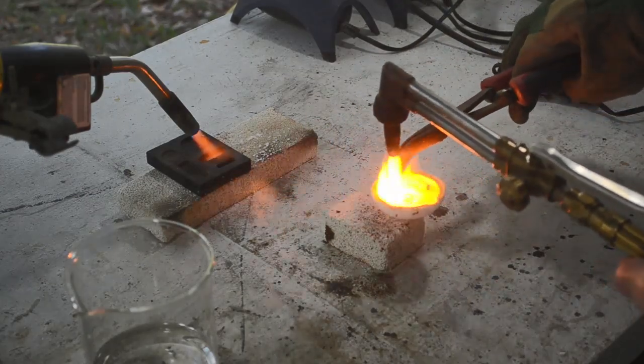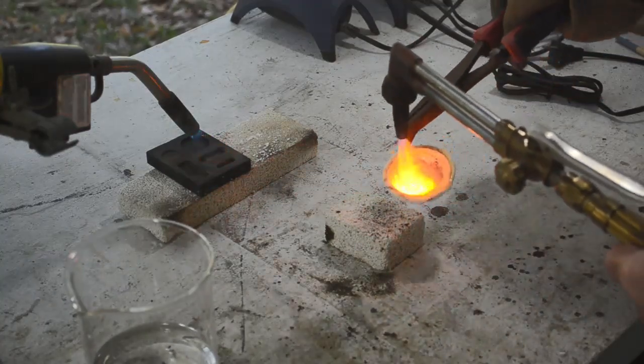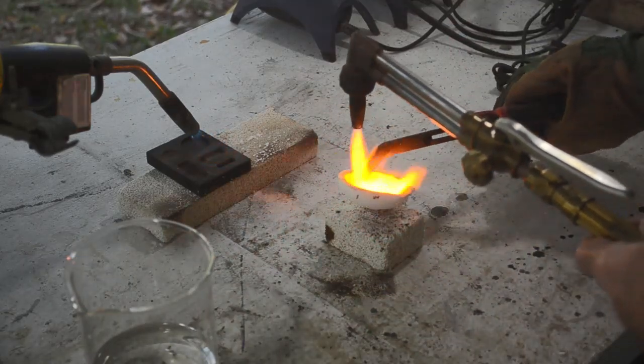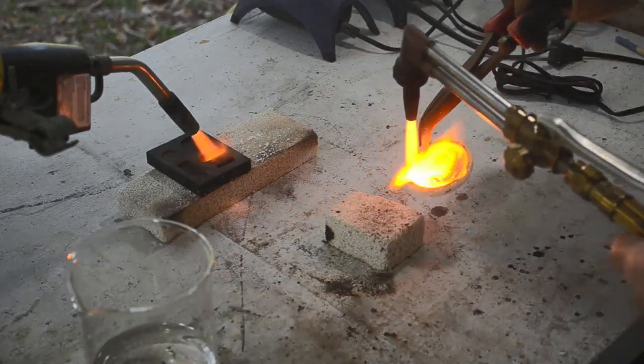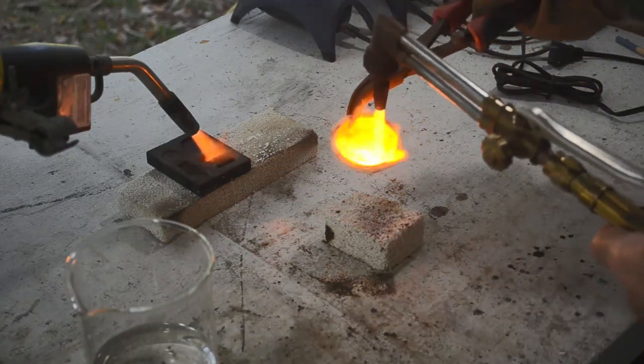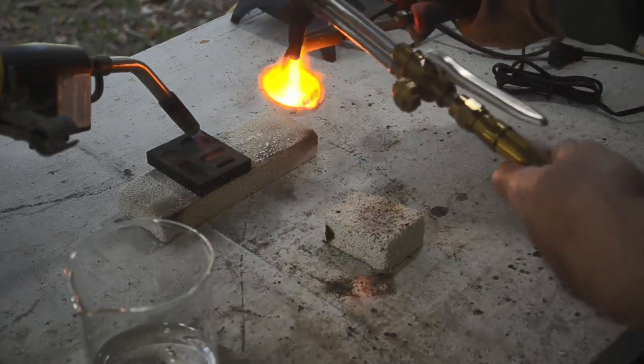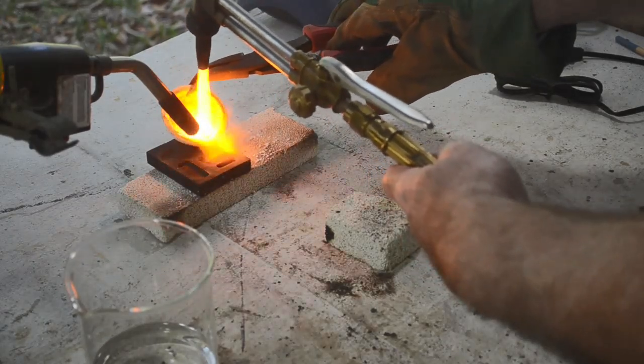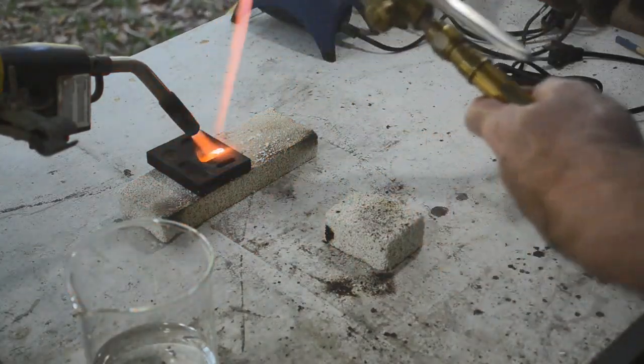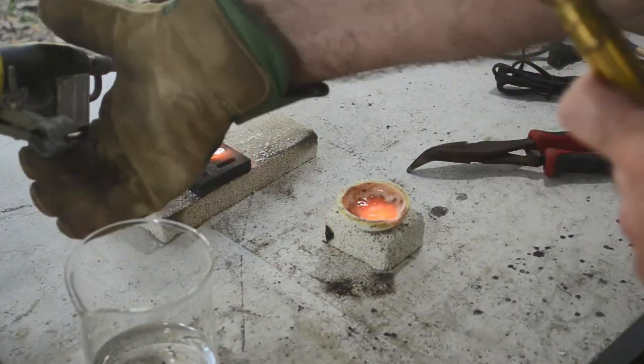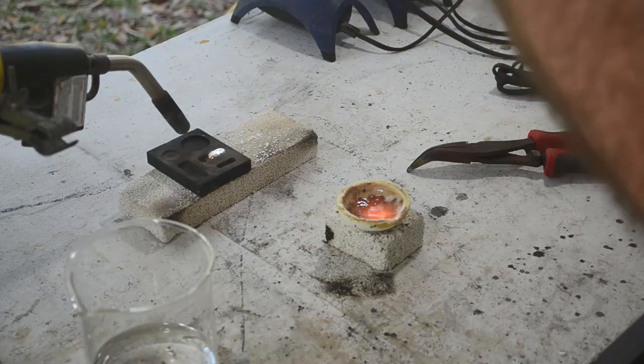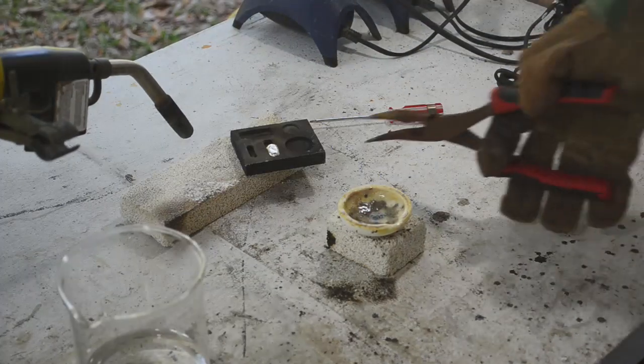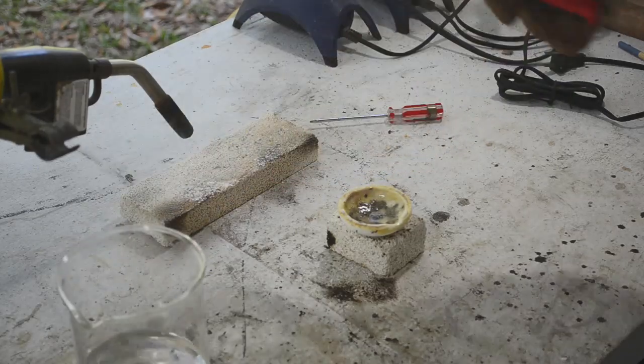Get all these little beads to consolidate. Without spilling it. All right. All right.